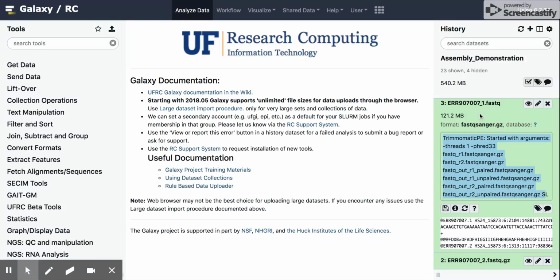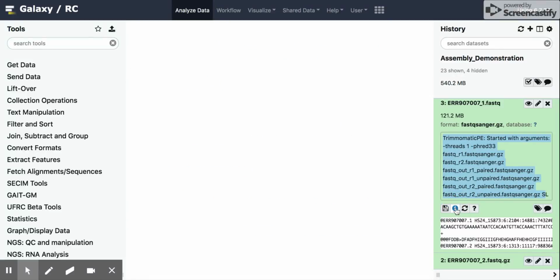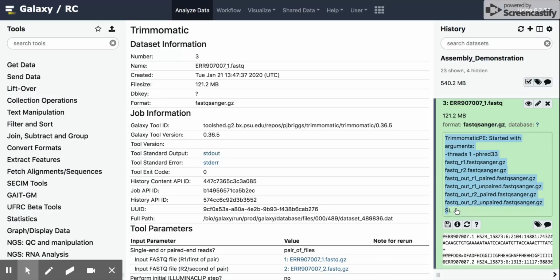We can also hit a number of different buttons here. The little floppy disk button here will save or download the data to either your computer or a drive you have attached to it. This info button, which we'll go ahead and click here, will provide you more information about the step that was run. And then these little double arrows here will be to run the job again, which we'll use in a second.